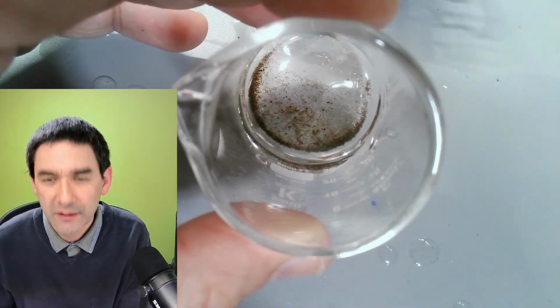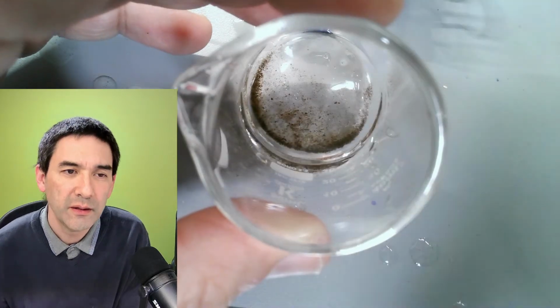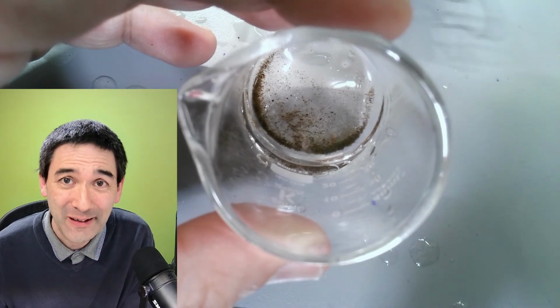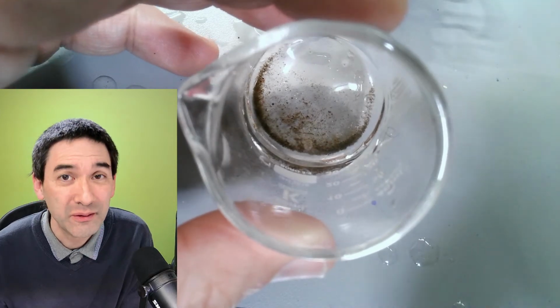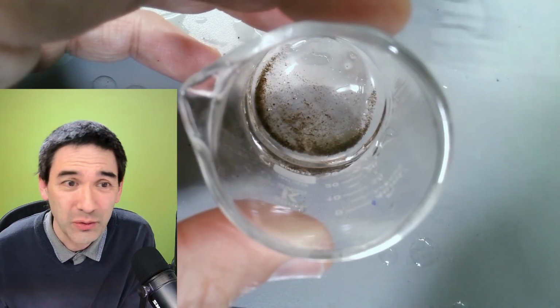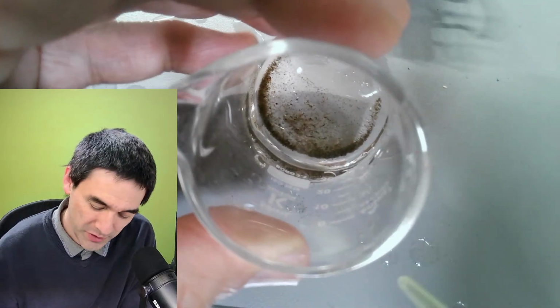Honestly, things like this are always a question of patience and a question of luck. Okay, so today in the afternoon, on the first slide I could not find any water bears, but on the second try I did. So usually it was 50% successful. One of the water bears was actually also quite big.